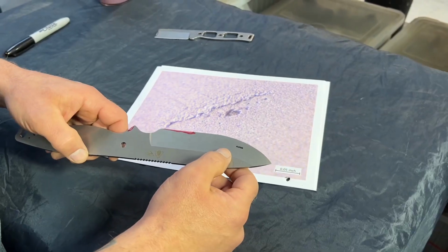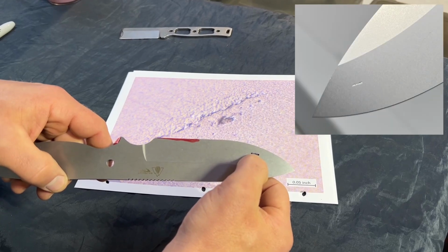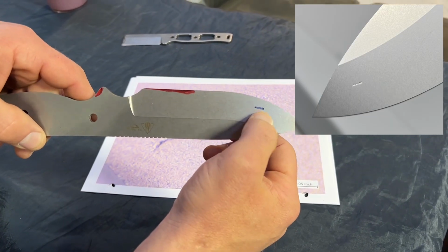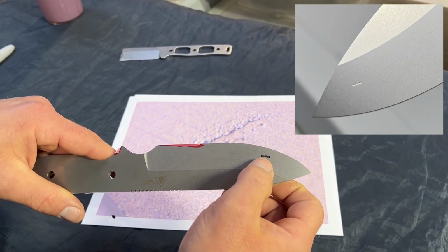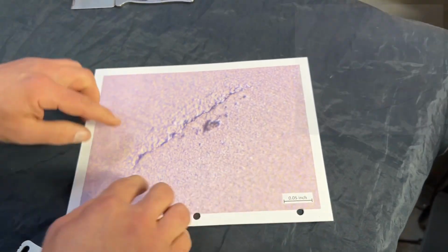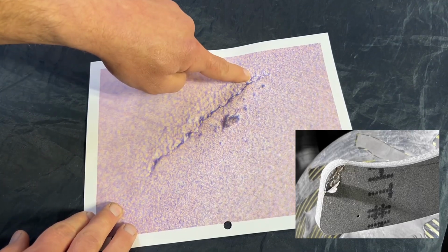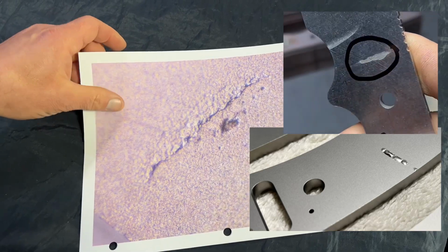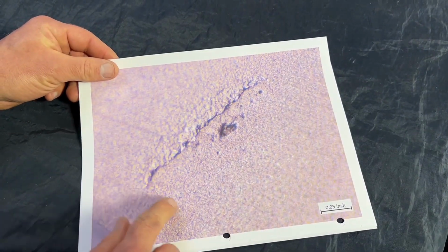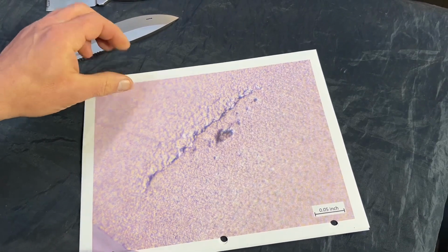As you can see in earlier videos, I've been sending some samples out to different labs where they had just a mark on them that looked like that, just in that area and some different spots on blades. But as you look closer at what looks like a crack now under the higher level of microscopy here, you can see that this is very much a delamination situation. So this is going to tie in to the other voids and things that I was showing in other videos and photos. But as you zoom in closer and closer on this, you can see how wide this is across here. It's the thickness of a daggone blade in width. But I know based on previous observations that they're really long.